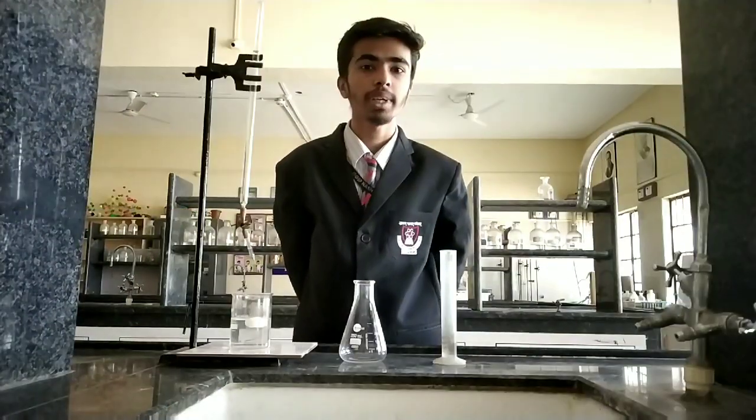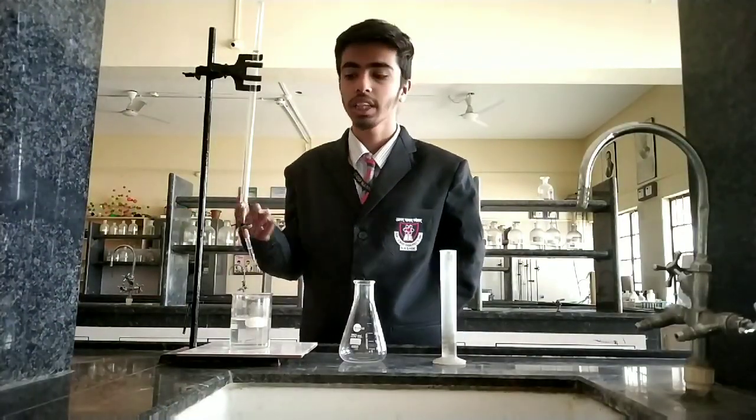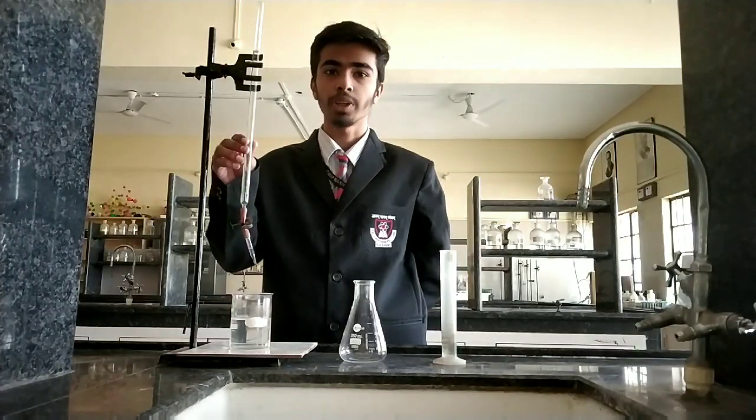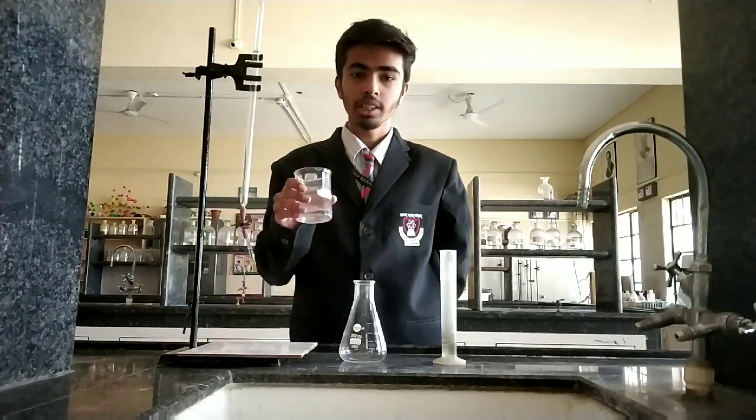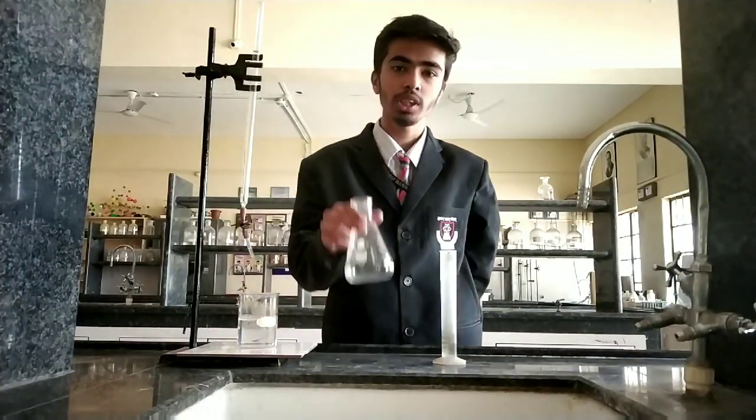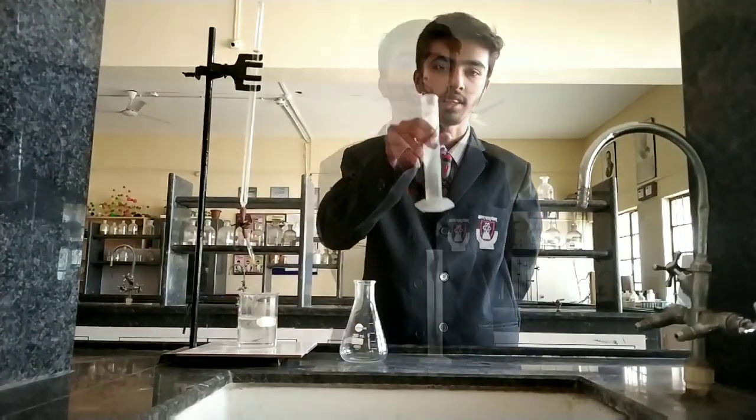So, without any delay, let's start our practical. For practical, we are going to need the following lab apparatus. This is Burette. This is Beaker. This is Conical Flask. And this is Measuring Cylinder.